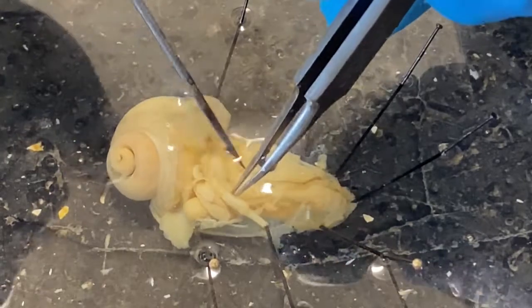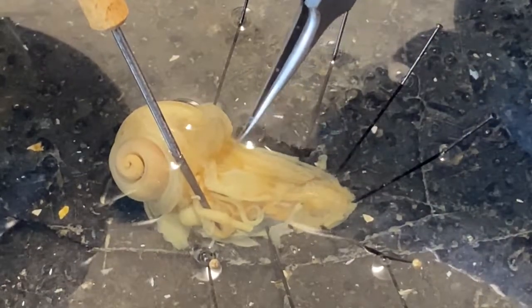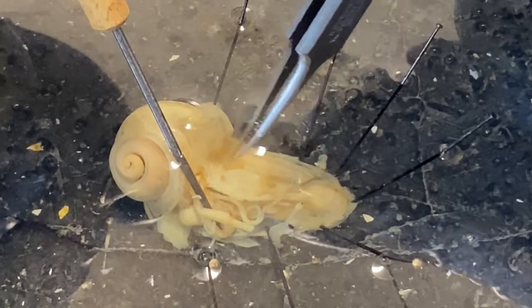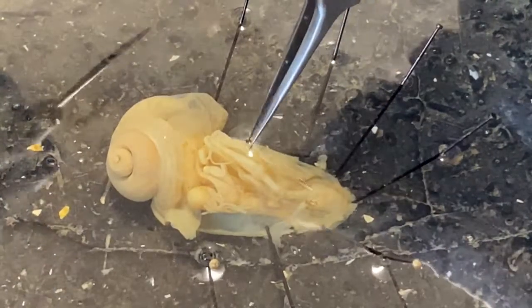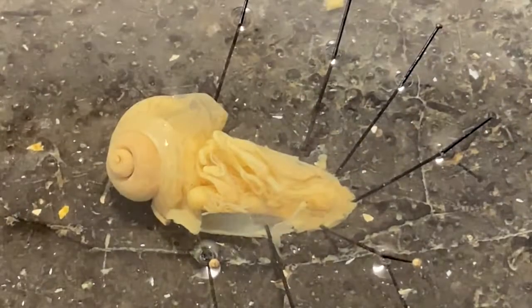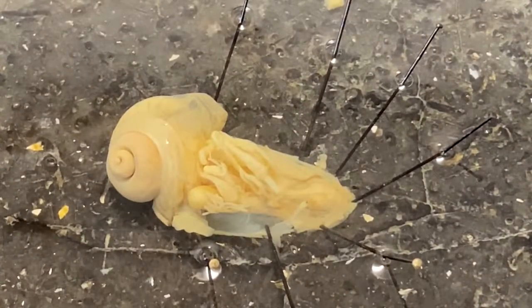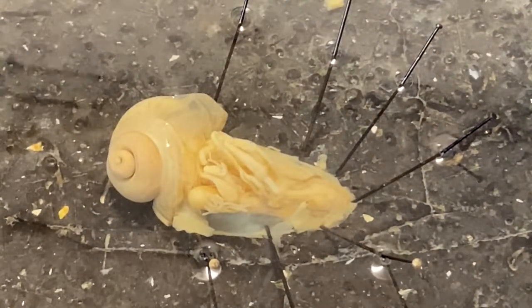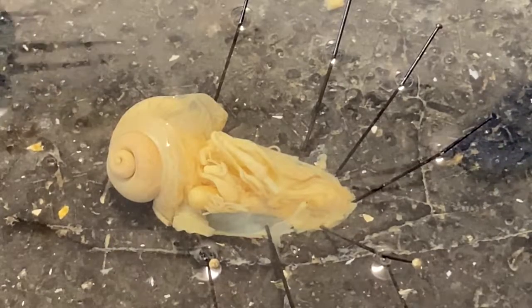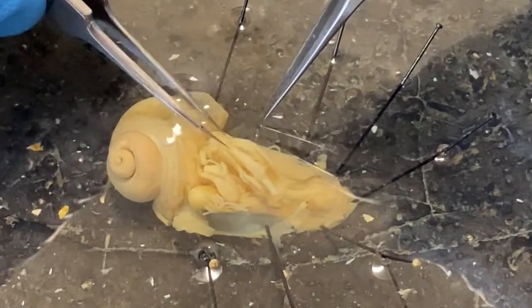The esophagus comes back here to a crop that runs underneath all this stuff and terminates in a digestive gland. The best way to do this dissection, by the way, is with two forceps. Most people reach for a scalpel first, but with invertebrates these micro-dissections work a lot better if you use forceps to separate things.